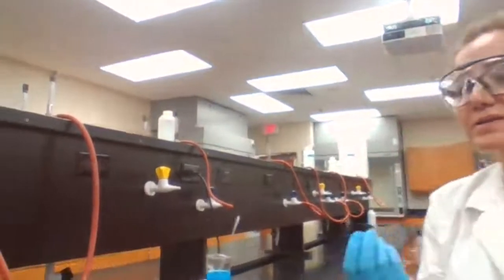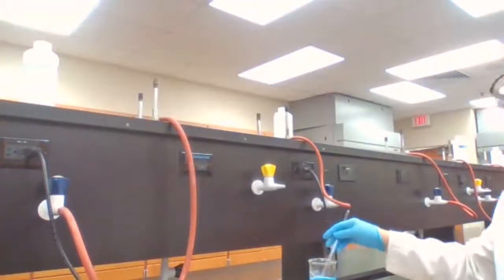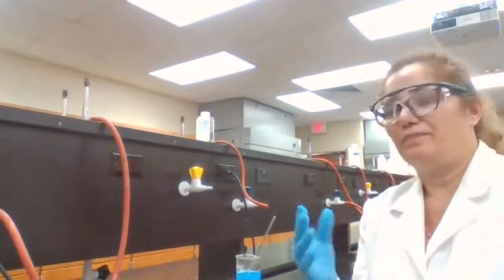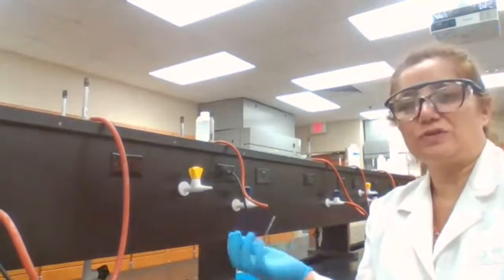Your question, if you could please type the question on the chat, I'm watching it now. If I missed your question, please say it again. Yes, it looks like a jello. Yes, it is. The liquid is not a, okay, I see what you're saying. So it's not the whole thing changing to solid.